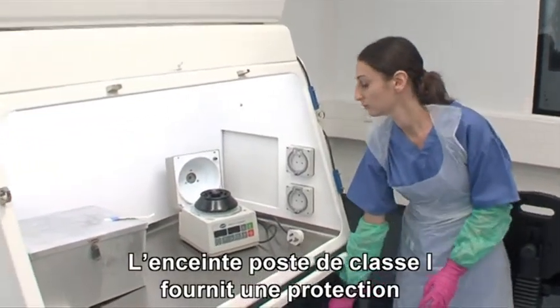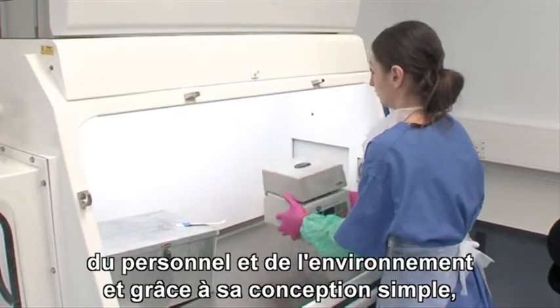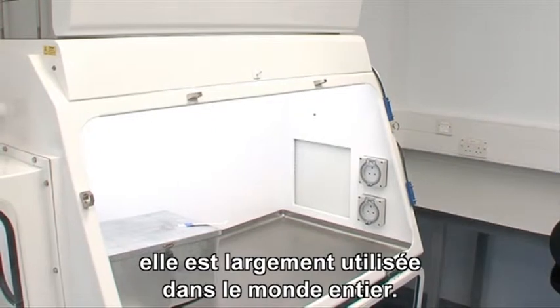The Class 1 cabinet provides personnel and environmental protection and, because of its simple design, is still widely used throughout the world.